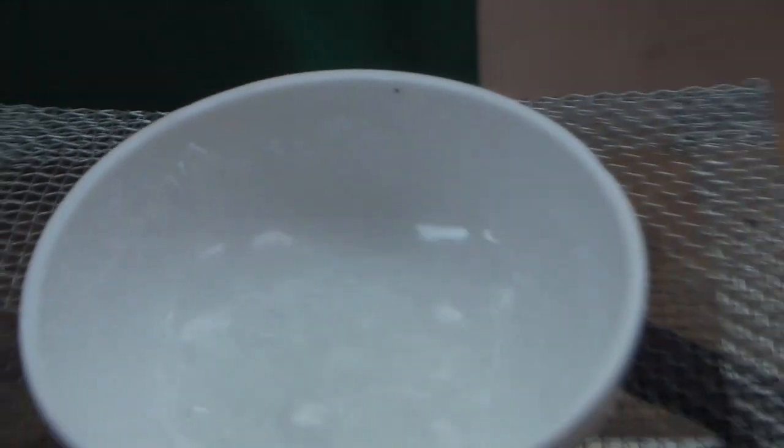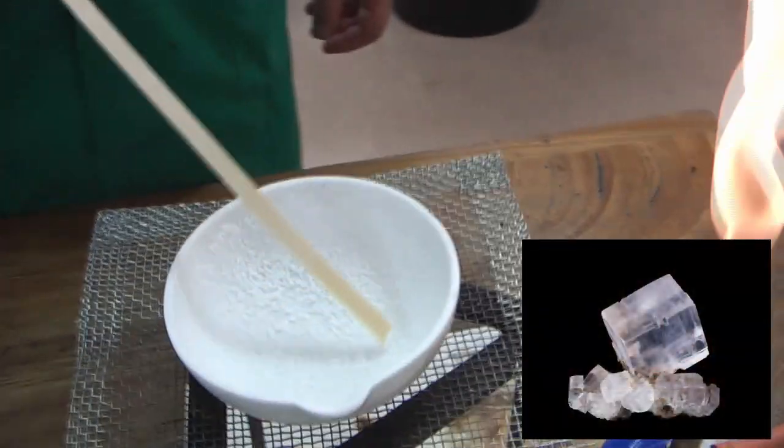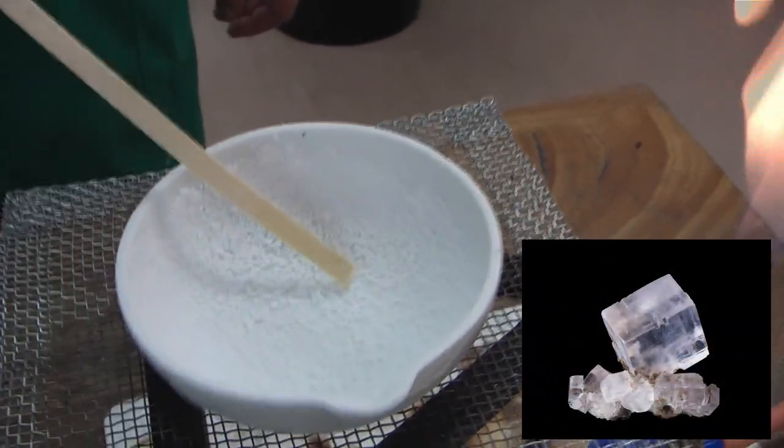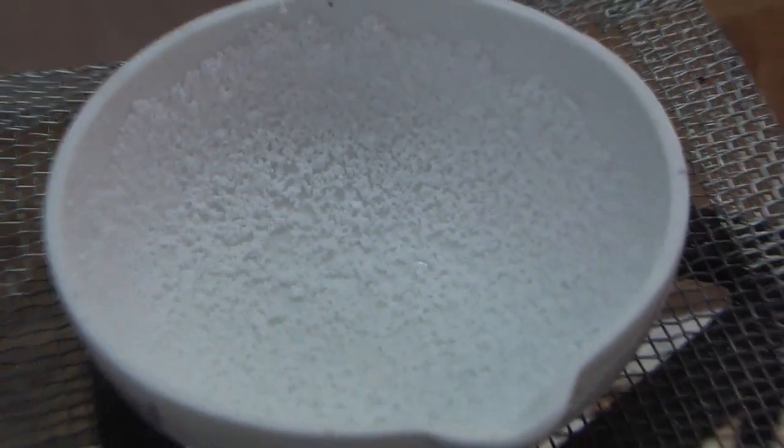For that, we need a separate technique. So here we are at the end. And you can see inside now, we've got all the salt crystals that have formed. It's still quite hot, so I'm not going to touch it. We've got the salt crystals all forming there. And the water has disappeared. We've separated the two, and we're left with the salt.